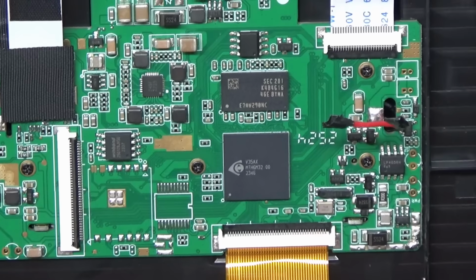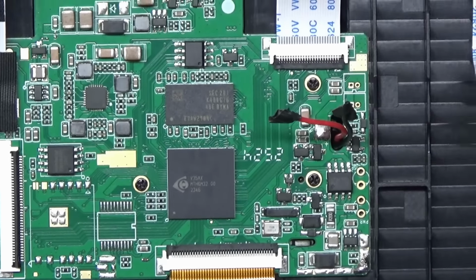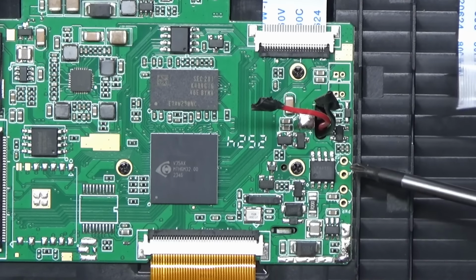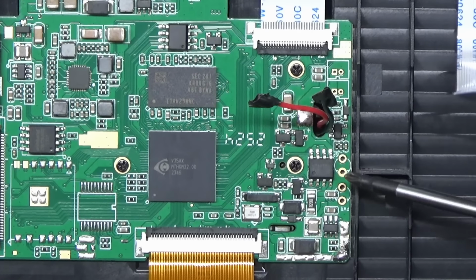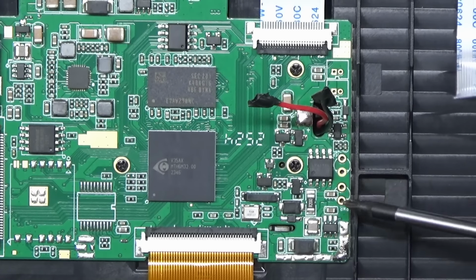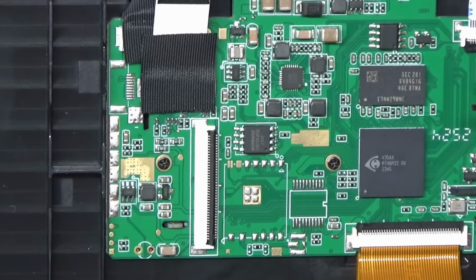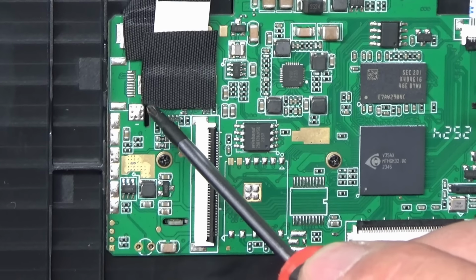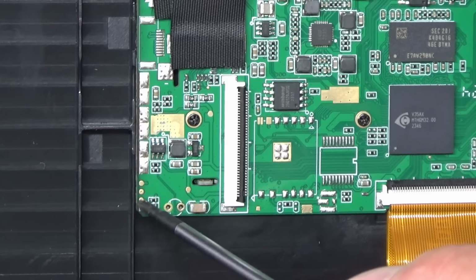So I wonder if there's any serial debug or anything on this. There's a couple of connectors there. There's one marked ISP, and one marked PWR. So I wonder if those have been for LEDs possibly. Looks like we've got a connector here, or a space for a connector. It looks like there may be some kind of header here.